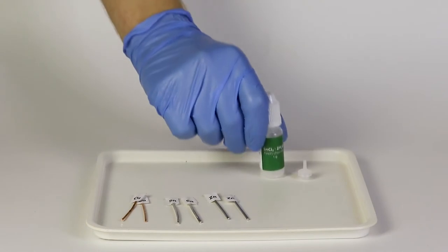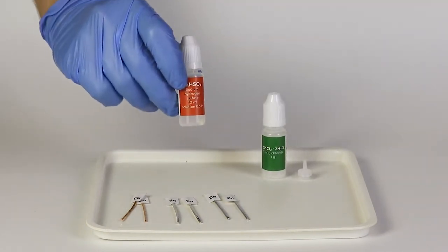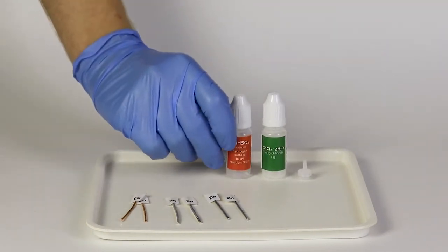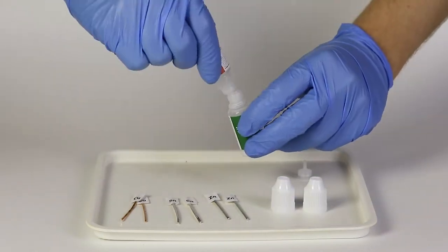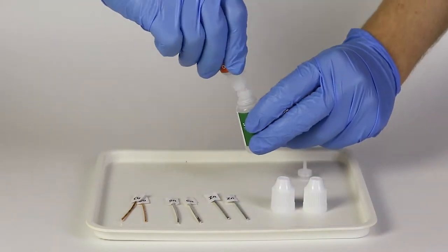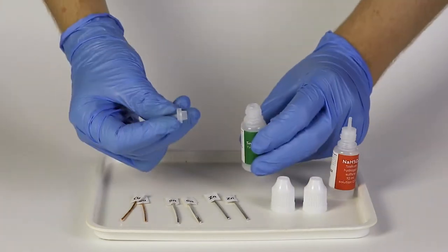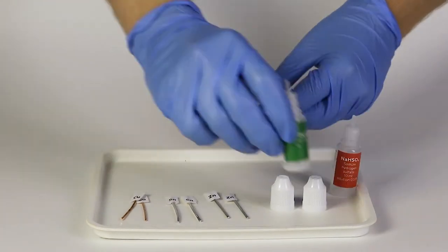Then take the bottle of tin chloride, and add all of the sodium hydrogen sulfate solution to it. Close the bottle with the plastic nozzle.